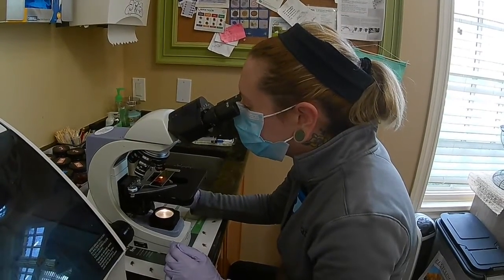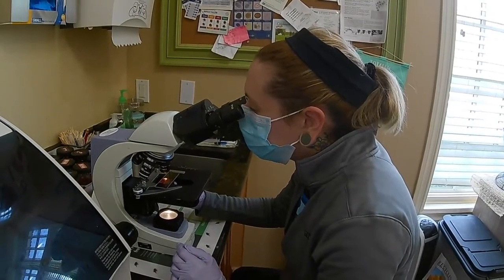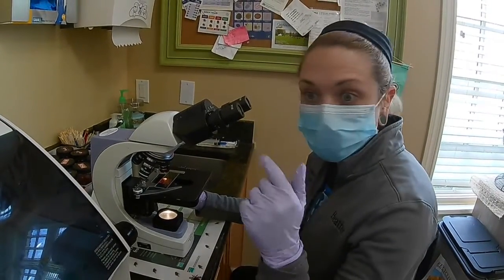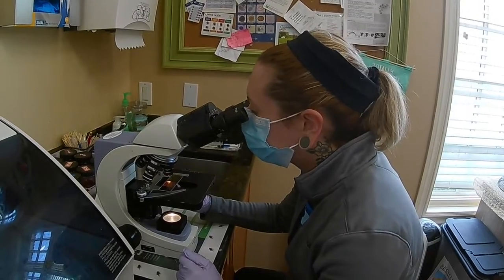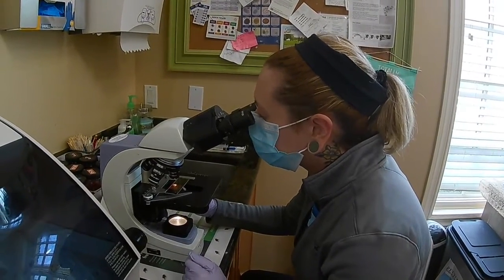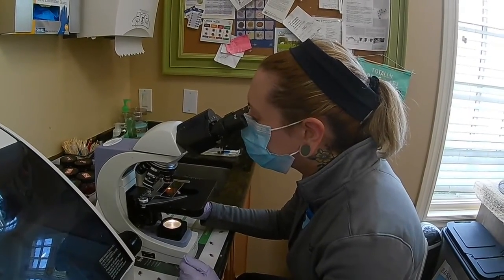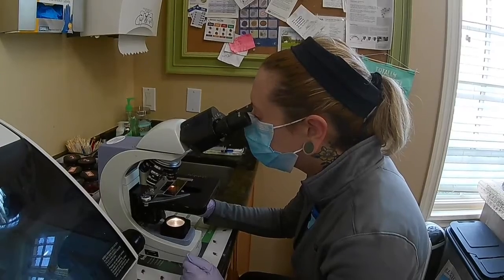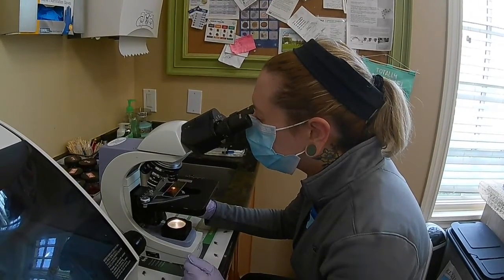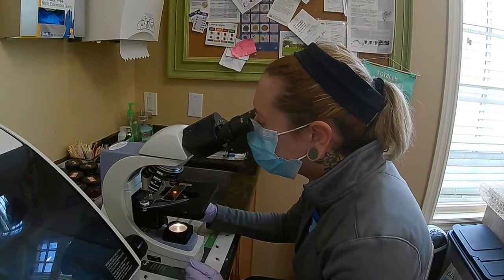What I want to do is look through my sample. If there were to be any microfilaria, you would see them swarming around through the red blood cells that are present. So I'm going to move down, and then I'm going to move over, go back up. Just do a quick once over my sample on low power.